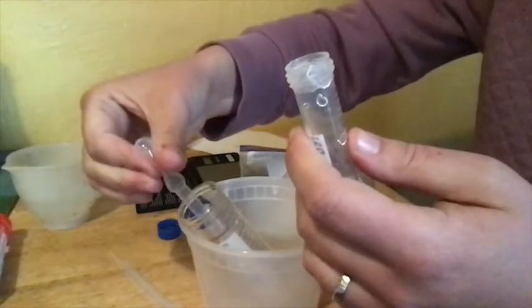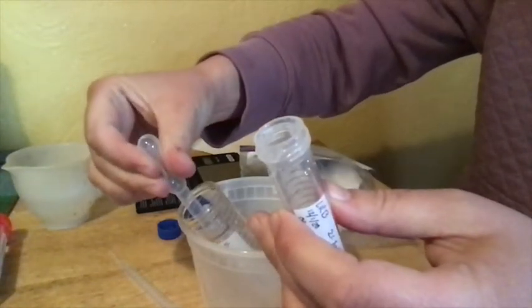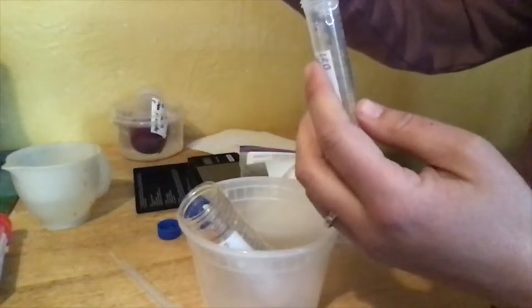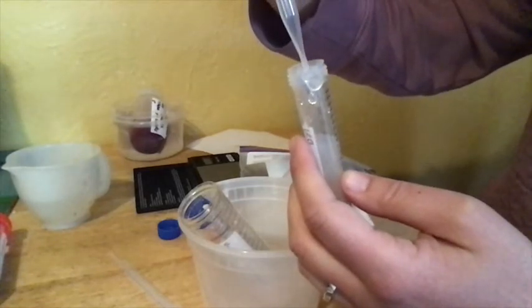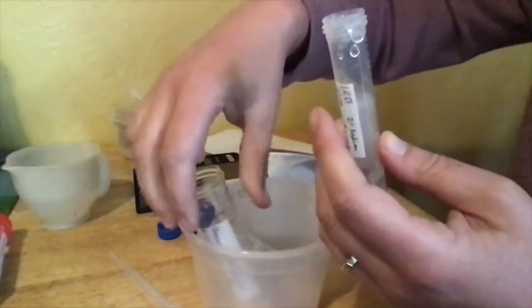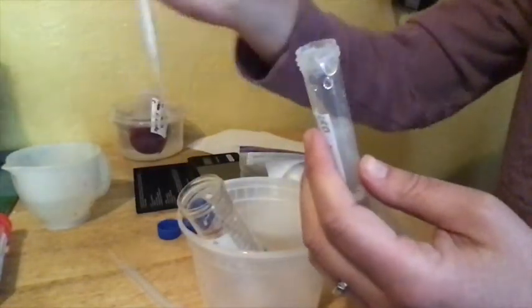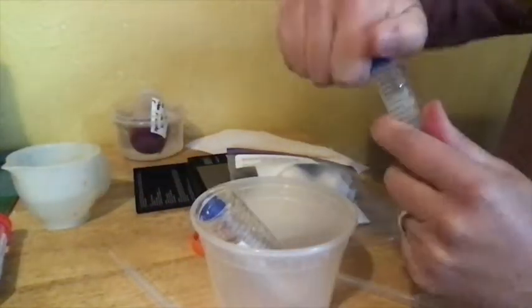Alright. So, you want to try and make sure you're getting the urease liquid from the top and none of the sediment. Fill up your transfer pipette there, and you're going to use the markings on the side of the sodium alginate tube to judge when you've added about three milliliters. Again, try to make sure you don't get any sediment in the pipette. You don't transfer any of that over into your sodium alginate tube. And then you just want to mix this so that the two solutions blend completely.